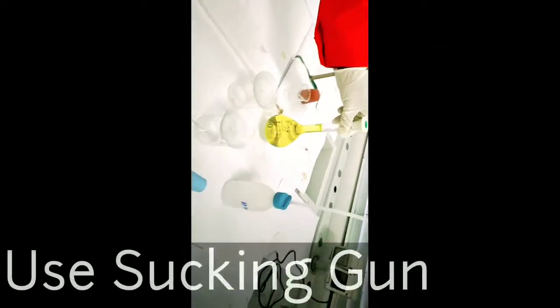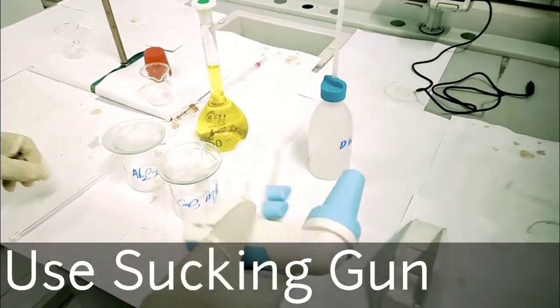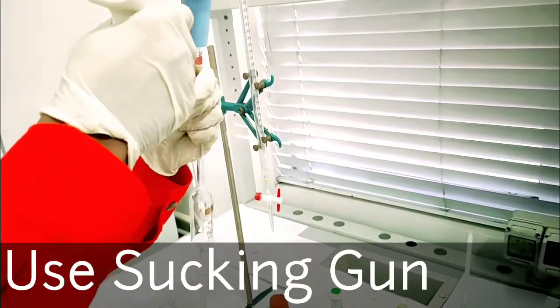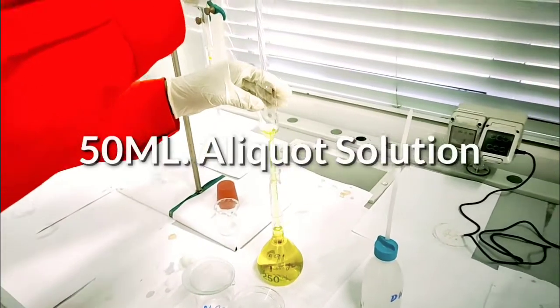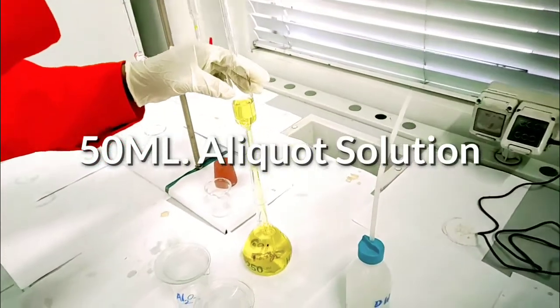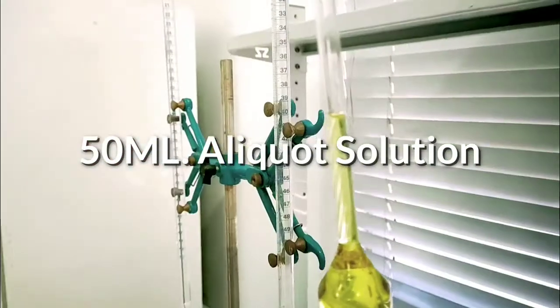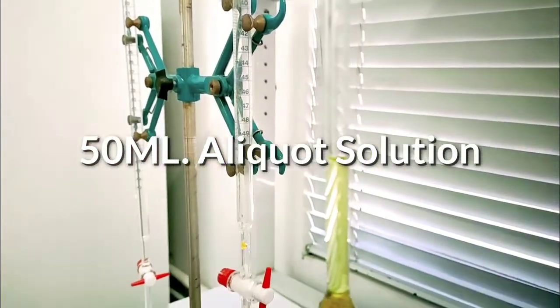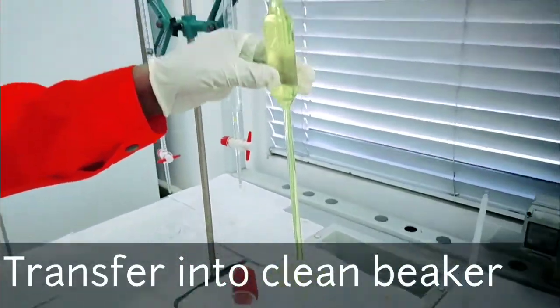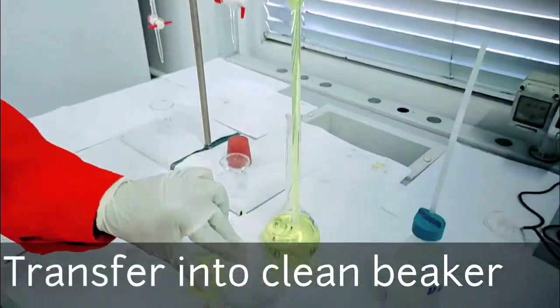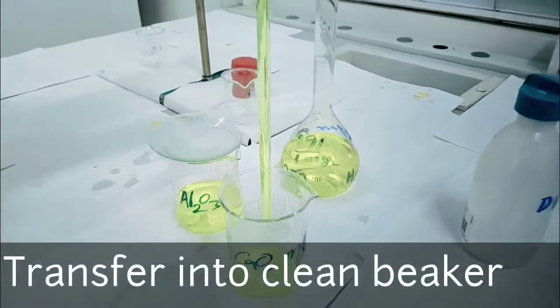Take a clean beaker. Use a sucking gun to pipette out 50 ml aliquot solution. Transfer into a clean beaker.